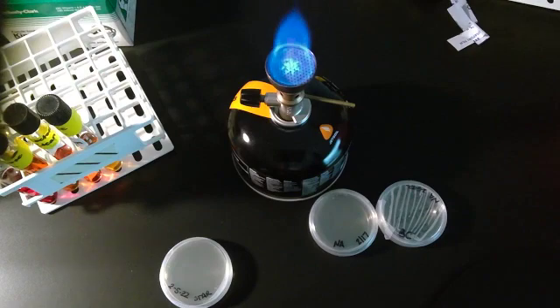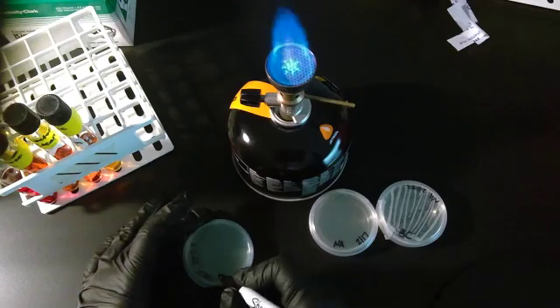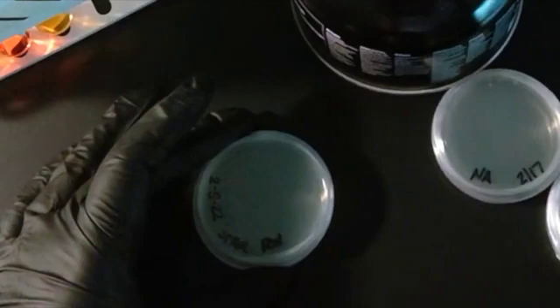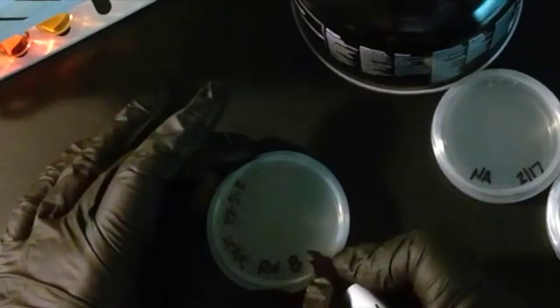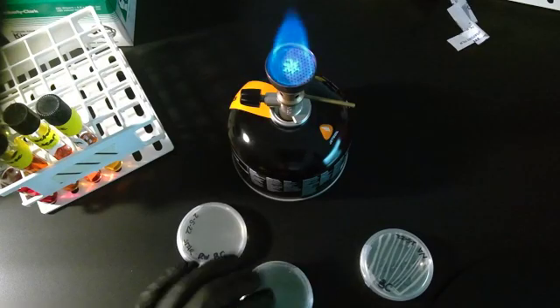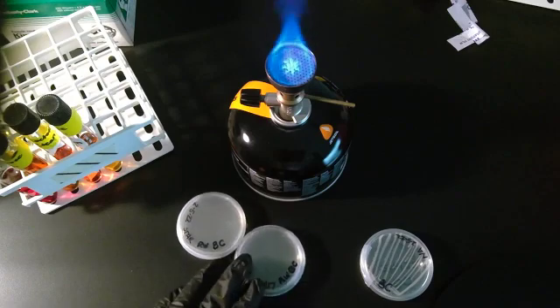One of the things that you have to do when you're preparing to do this is label everything. I am Ronica Williams, and the bacteria that I am going to use in this example is Bacillus cereus. So I label my plates. There's the starch one, here's the nutrient agar, Ronica Williams, Bacillus cereus, sorry.